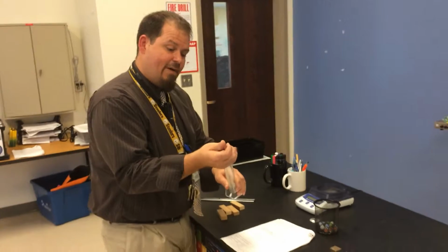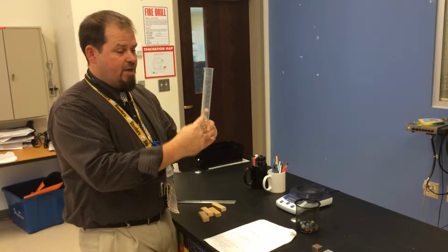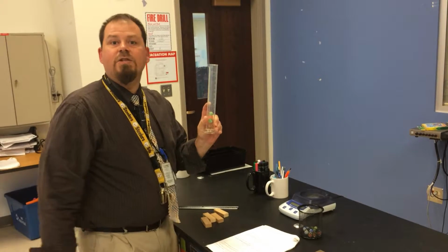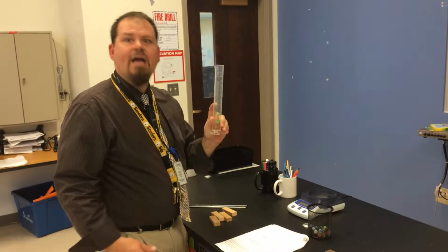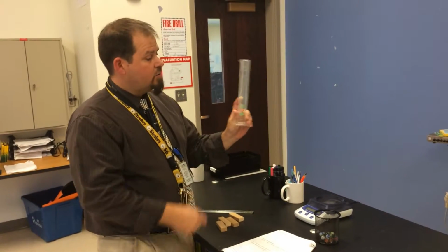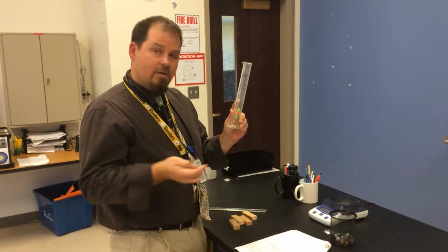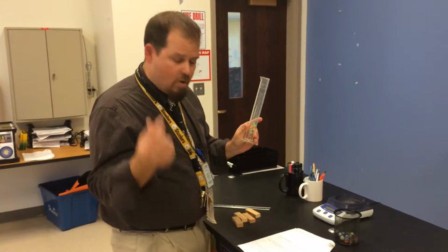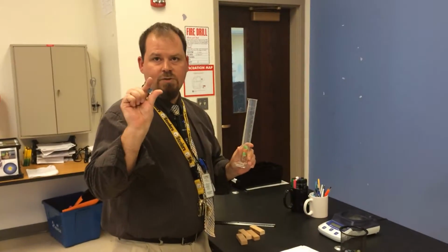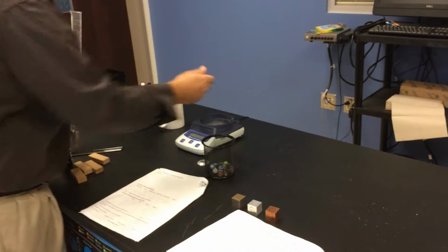Because then when I put in 5, that's going to change my volume enough that I can actually get a correct, accurate measurement. 1 might not change it enough, okay? So we'll use 5, do the total volume of 5, assume that each of their volumes are the same. When I divide, I'll have the volume of just 1. Good? Then I can get its mass of 1 and the density, and we're on our way.